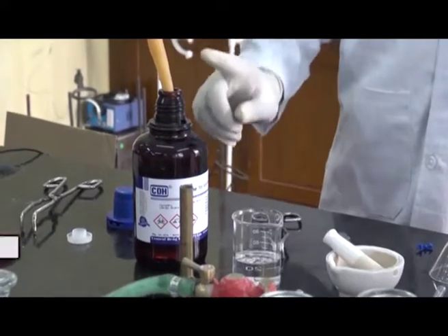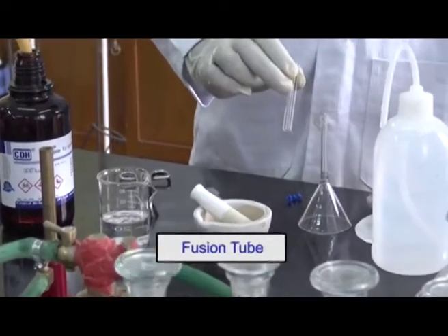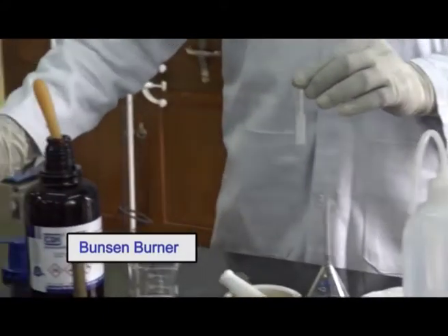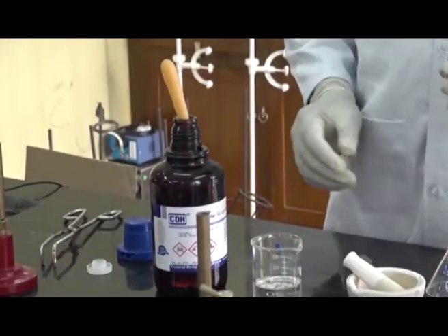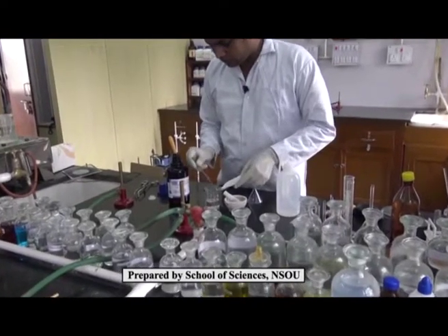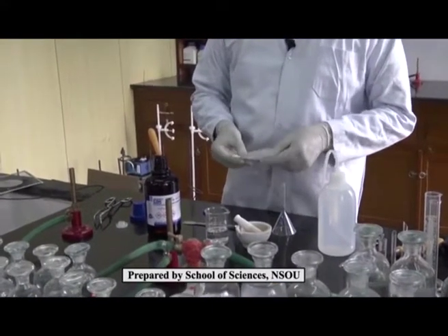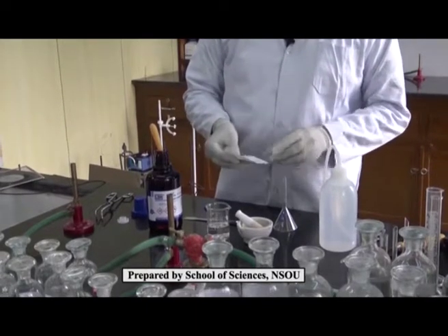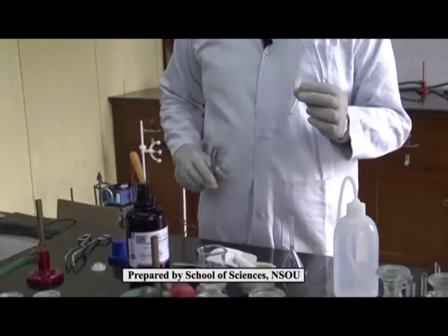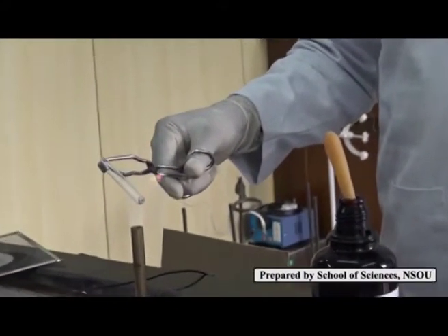For the Lassaigne test, we require the sample, sodium metal, mortar and pestle, fusion tube, filtering unit, distilled water, test tube holder, and Bunsen burner. Now we will do the test. At first, we have to take one sodium metal. Sodium metal must be freed from the paraffin oil so that it will be dried, and take the sodium metal into the fusion tube. Hold it with the tongs and melt it over the Bunsen burner.